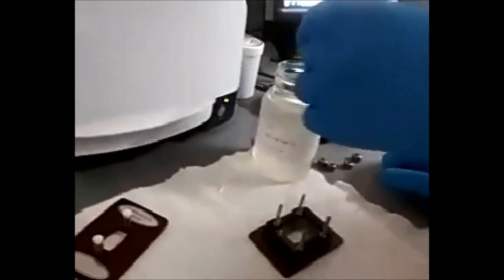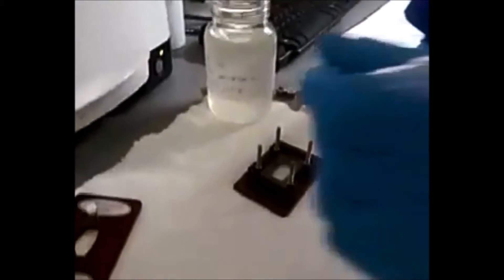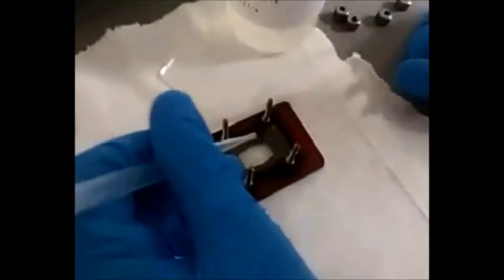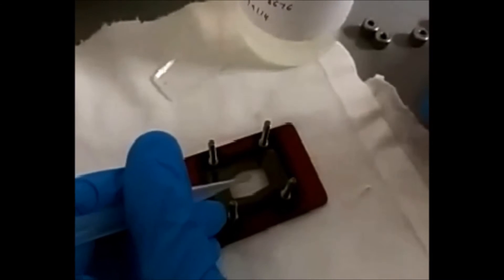Make sure you place this slide inside the cup that you have here. So this is the whole setup. I'm going to use a sample. Also remember not to use a lot of sample while doing the FTIR. Use as little sample as you can, because this is going to affect the FTIR.